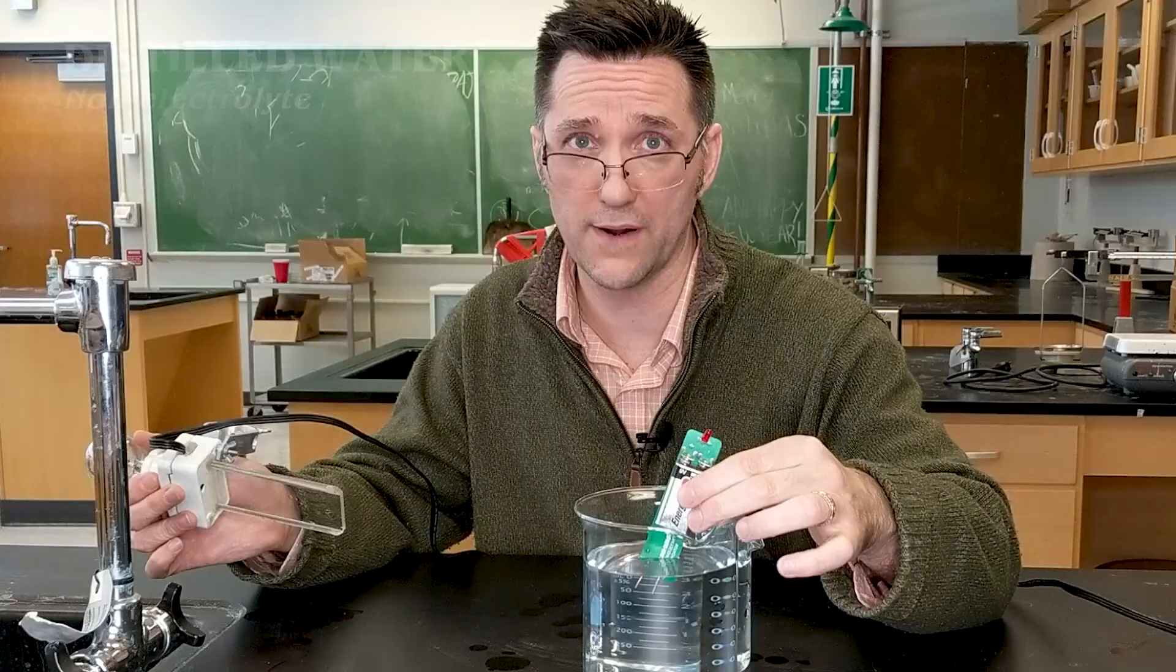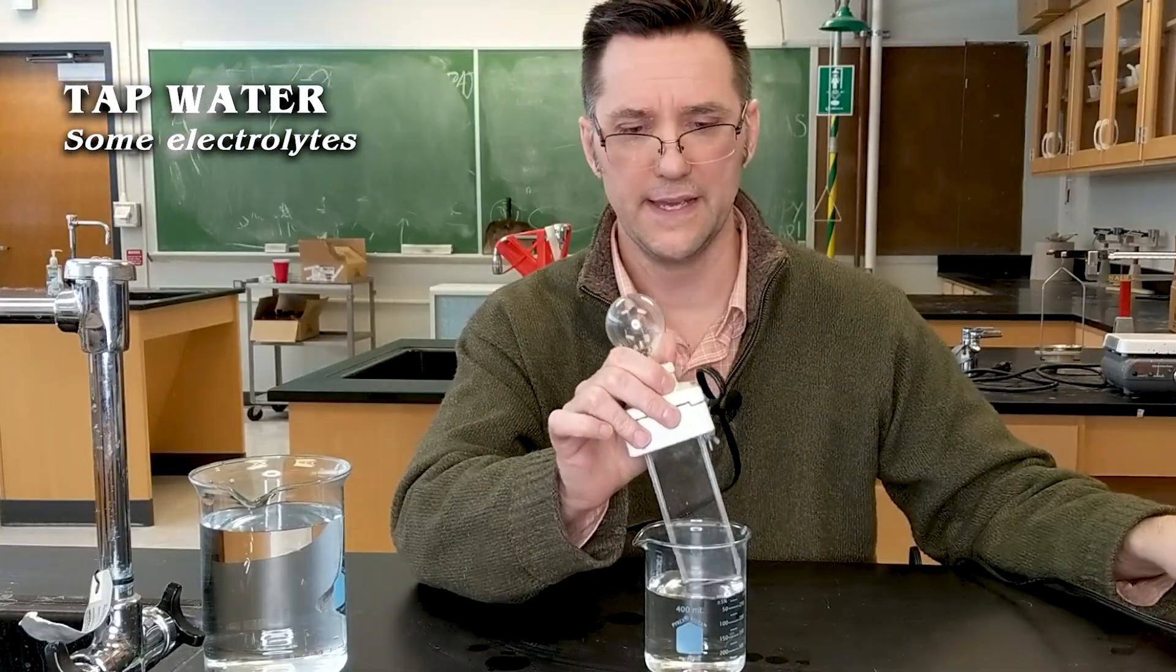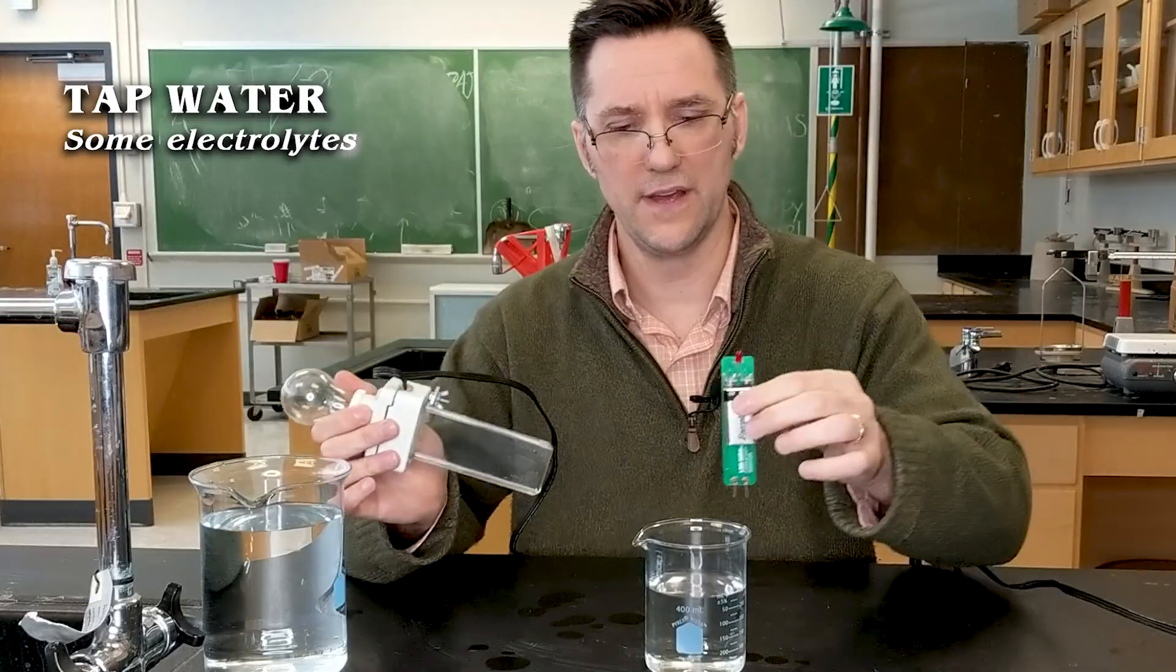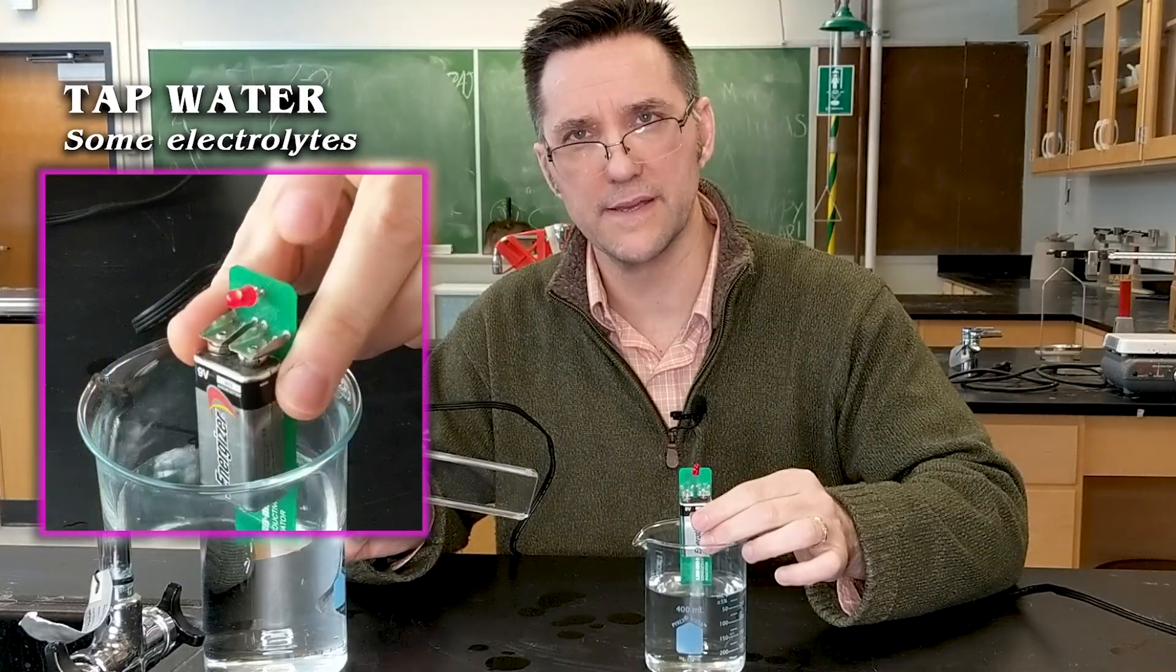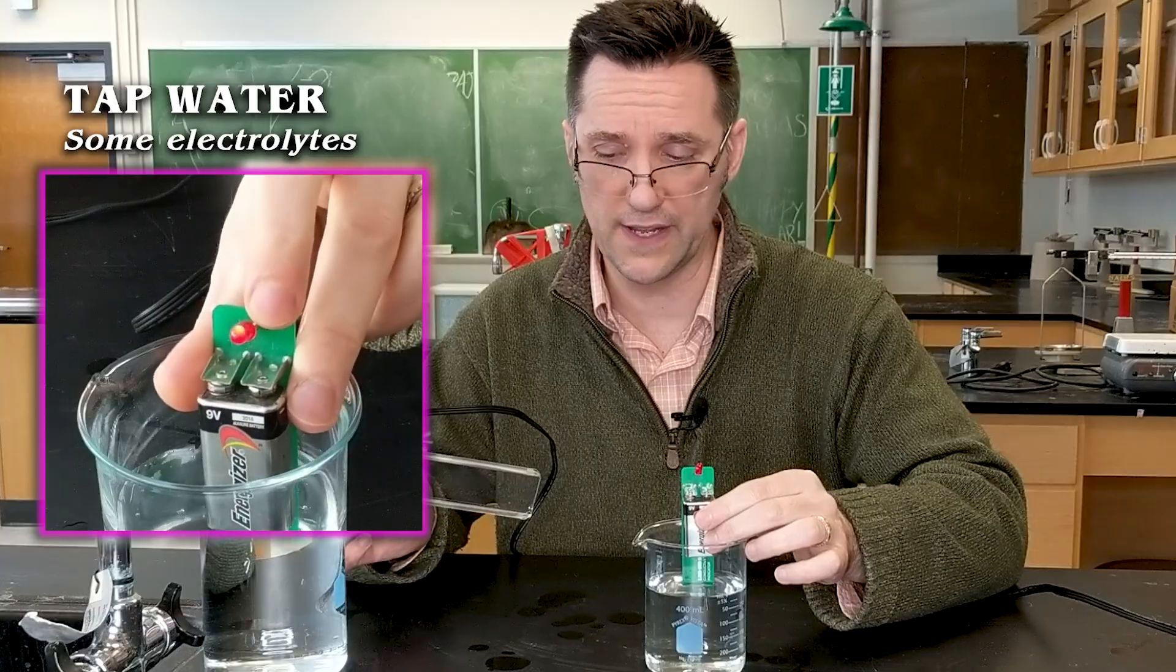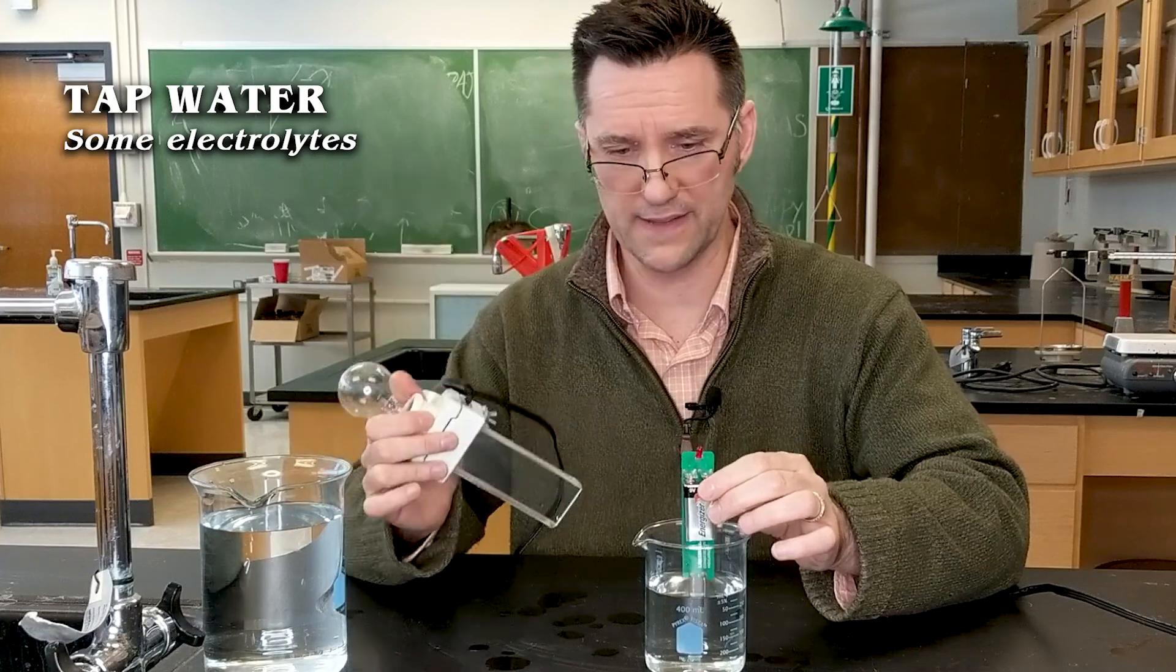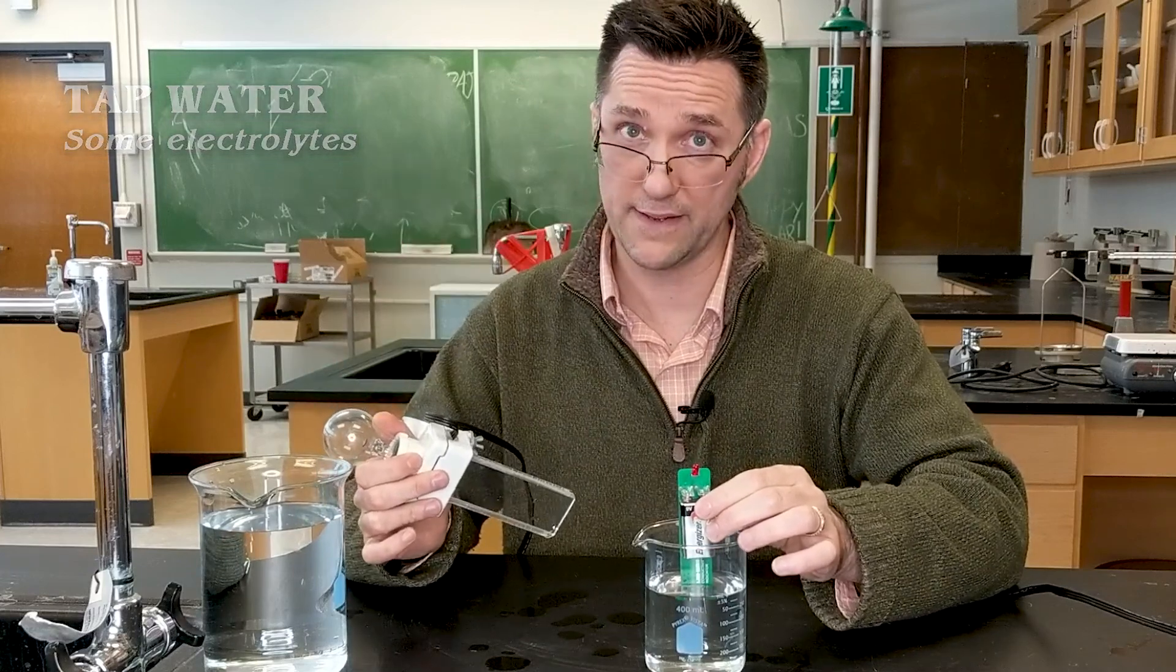Tap water is not enough to make this light bulb light. But if we use the other conductivity tester, we will definitely see it starting to blink. So there are enough ions in tap water to conduct electricity. Given the distance between these wires and the size of that bulb, I'm not surprised this isn't lighting up in tap water. But it's conducted.